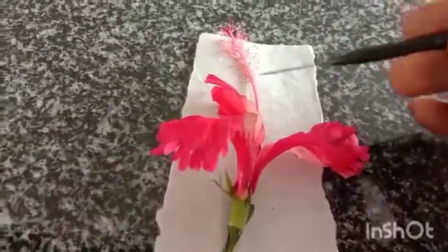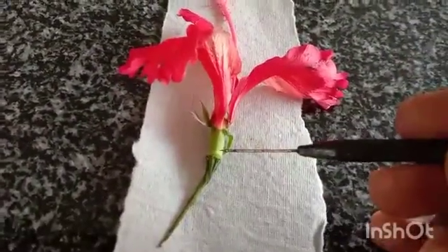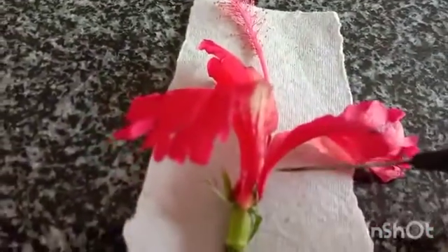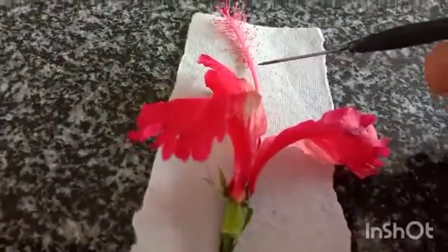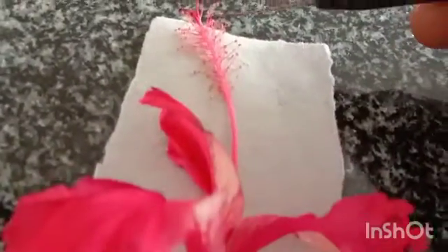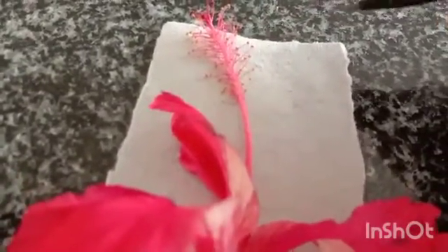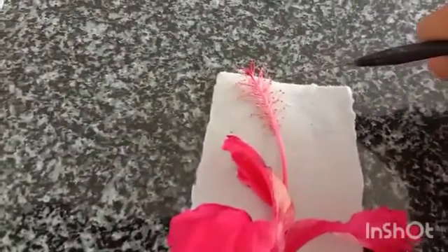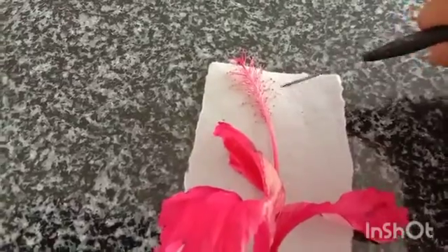Here the stigma is connected to the ovary. Here ovary is present with the help of style. This is stigma, which connects to the ovary. Style is present here inside. When we dissect it, you can observe. These are stamens. Androecium is the male part. Here anther is present and filament also present. These are the male parts.